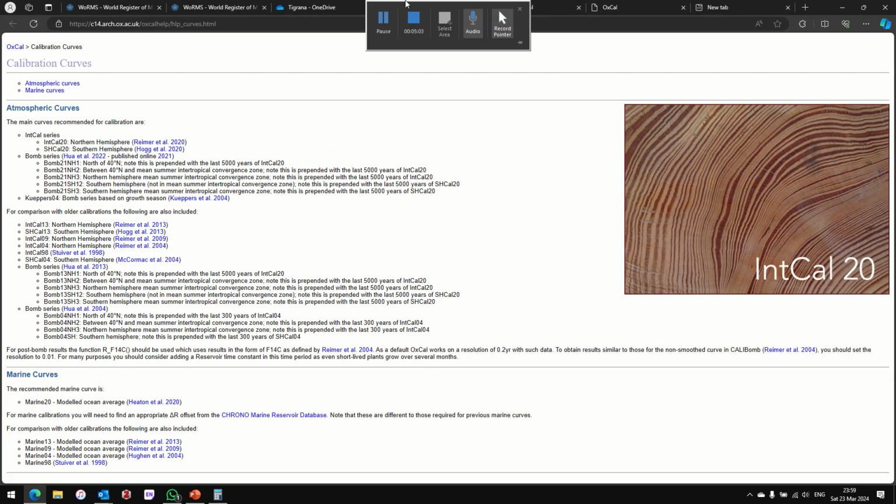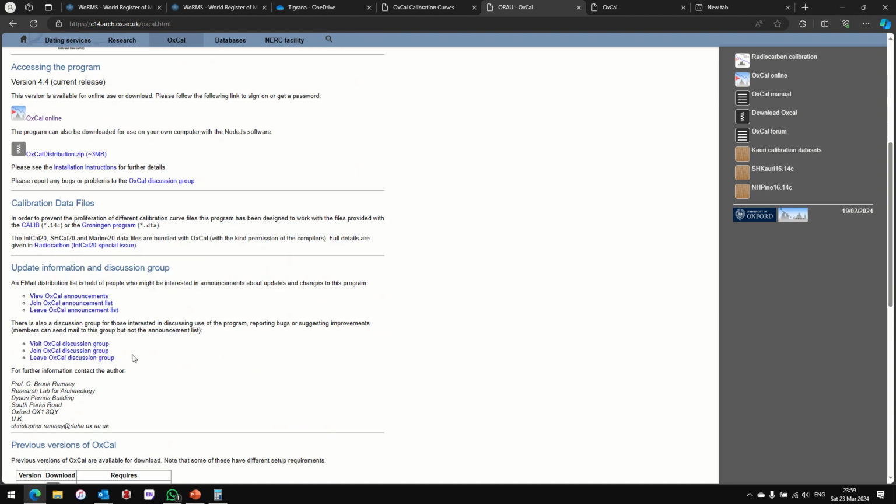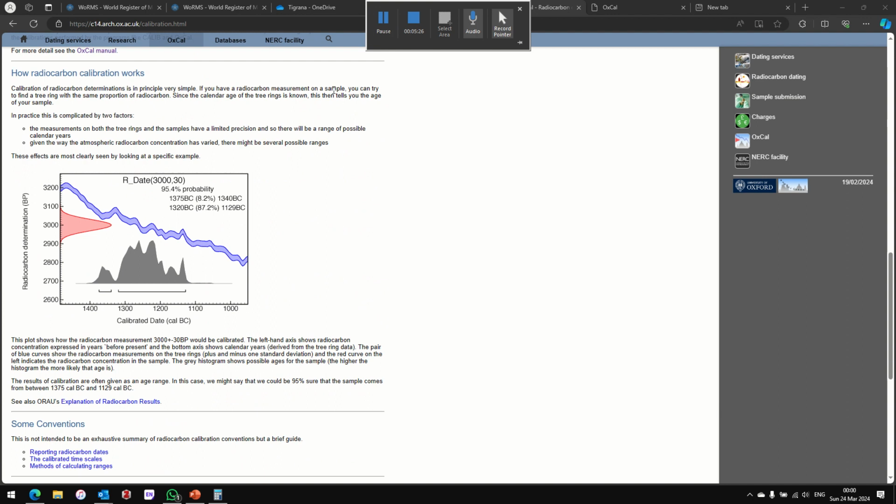And it says on the website that... I really don't know where is the online manual. And yes, when I go to the website, it says the red curve on the left indicates the radiocarbon concentration in the sample. So I mean, concentration is measured as what? The only way I can imagine concentration is moles per liter, or mass by mass, or mass by volume, something like that, or moles by volume, moles by moles.